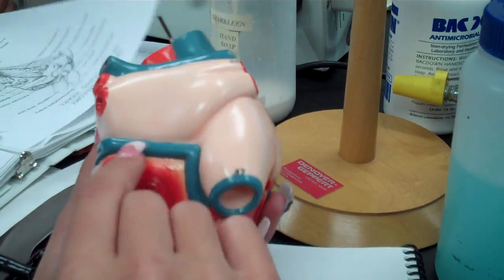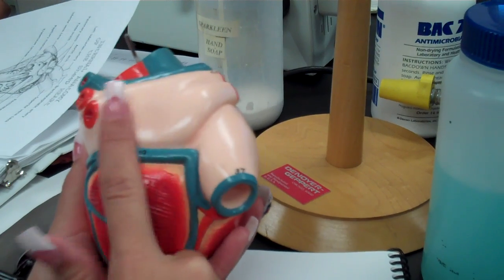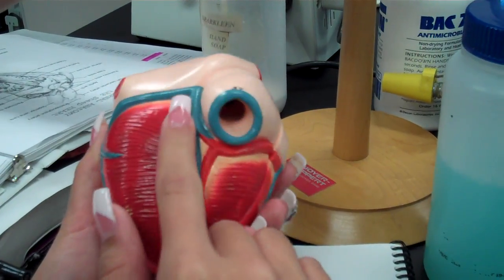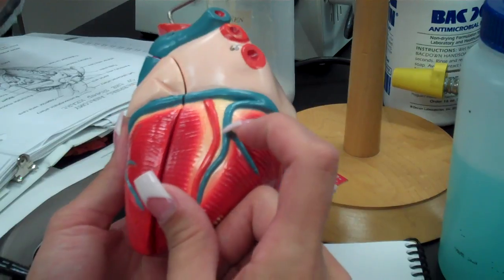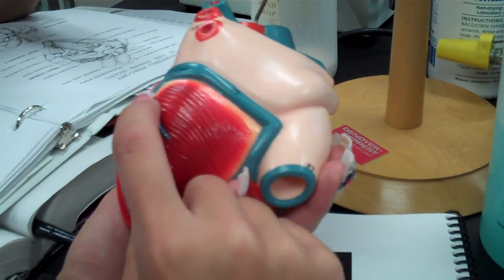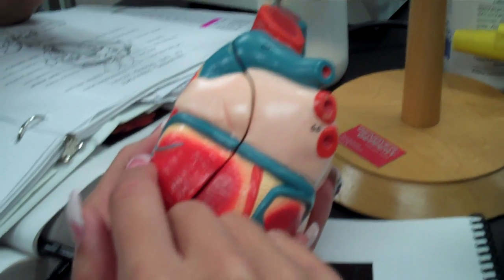You're going to know the back because you're going to have this big coronary sinus. It's your big coronary sinus. And this is your marginal, I know that, right? Yes. Your marginal vein. And then you're going to have your, what is the middle? Interventricular vein. Because you have your great, right? Your great. You have marginal vein.